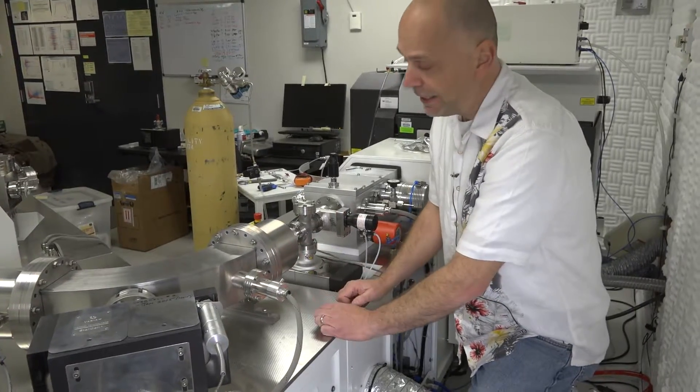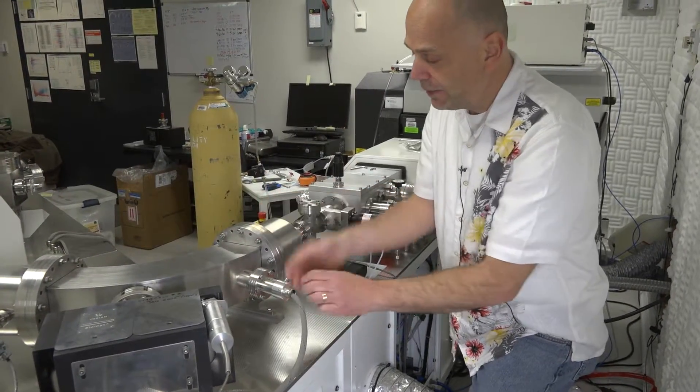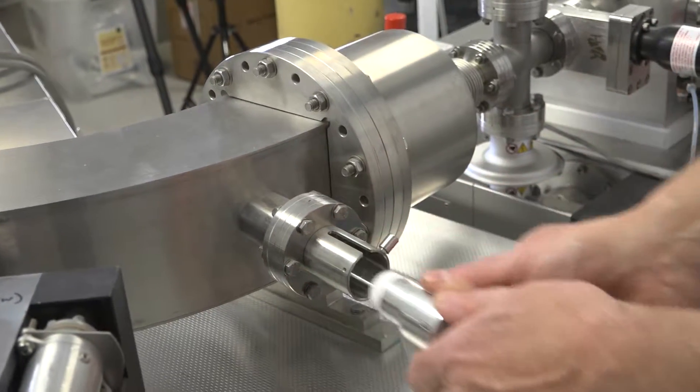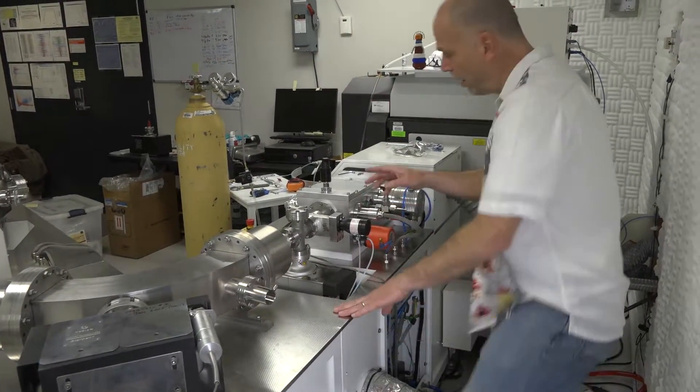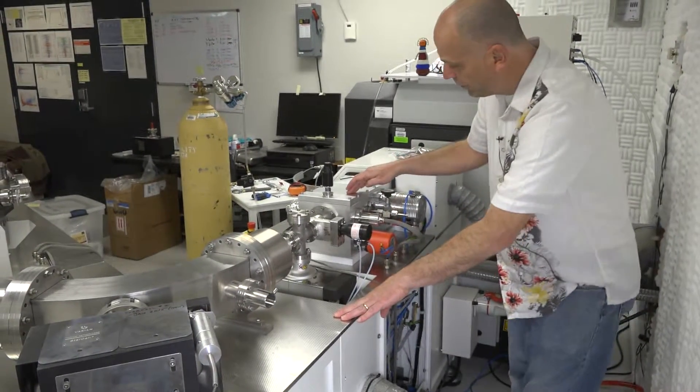Here on the back side of the instrument, we'll remove the feed through for the ESA and also the feed through for the transfer lens stack.